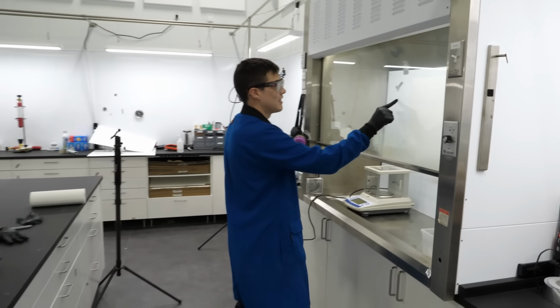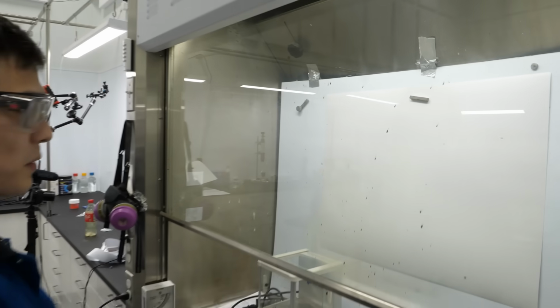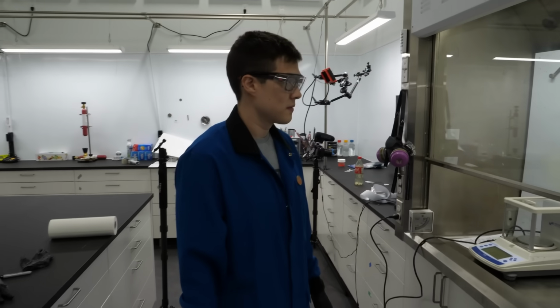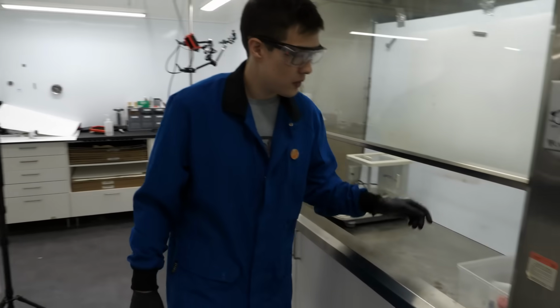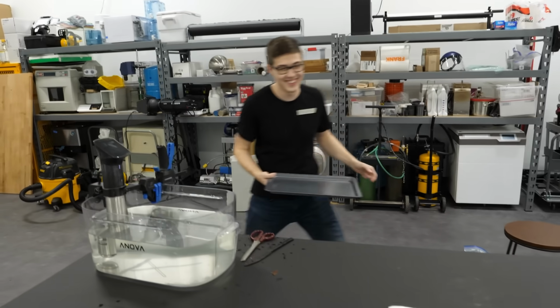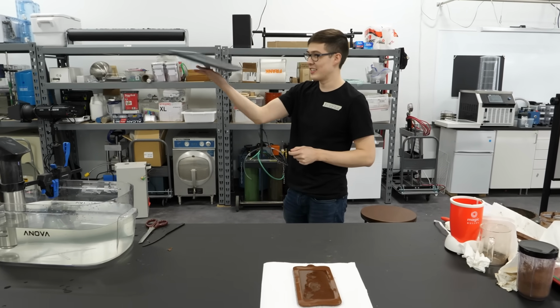Look. It's all silver metal that was splashed on the fume hood. I mean, probably should clean that up sometime. Anyway, oh, damn, that was sick. That was a once in a lifetime skill.